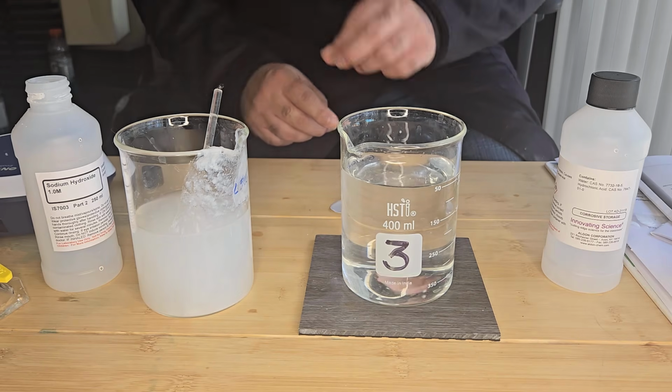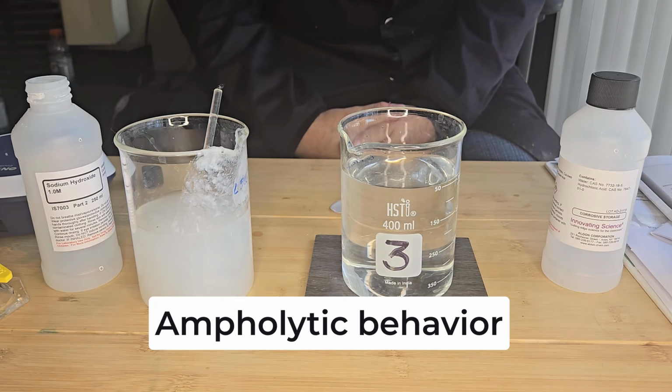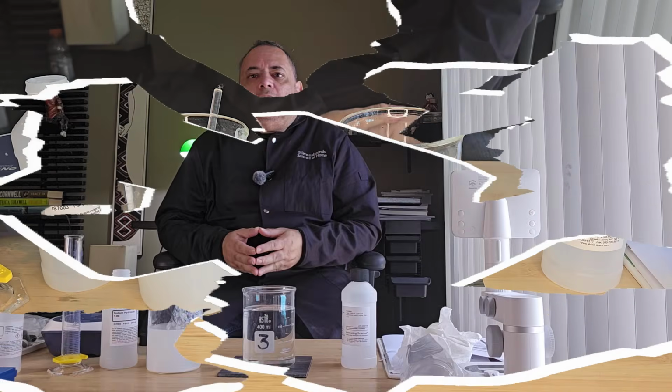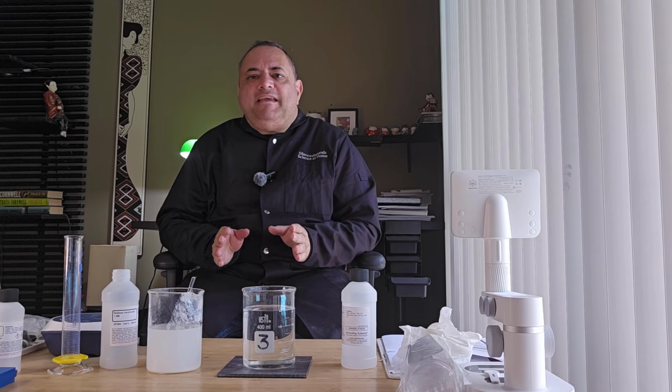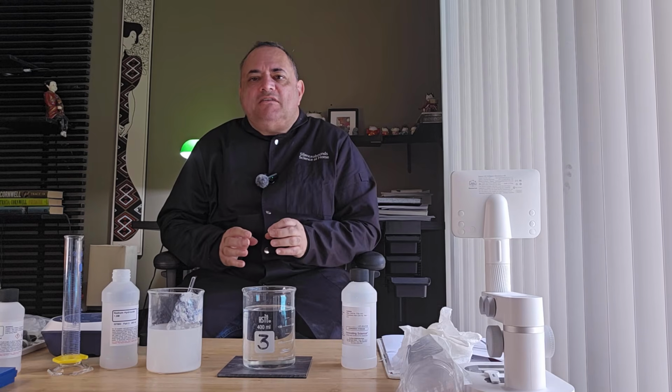Again, a demonstration of an amphoteric behavior and reaction. While that was a very simple, it was a fundamentally important demonstration of an ampholyte.